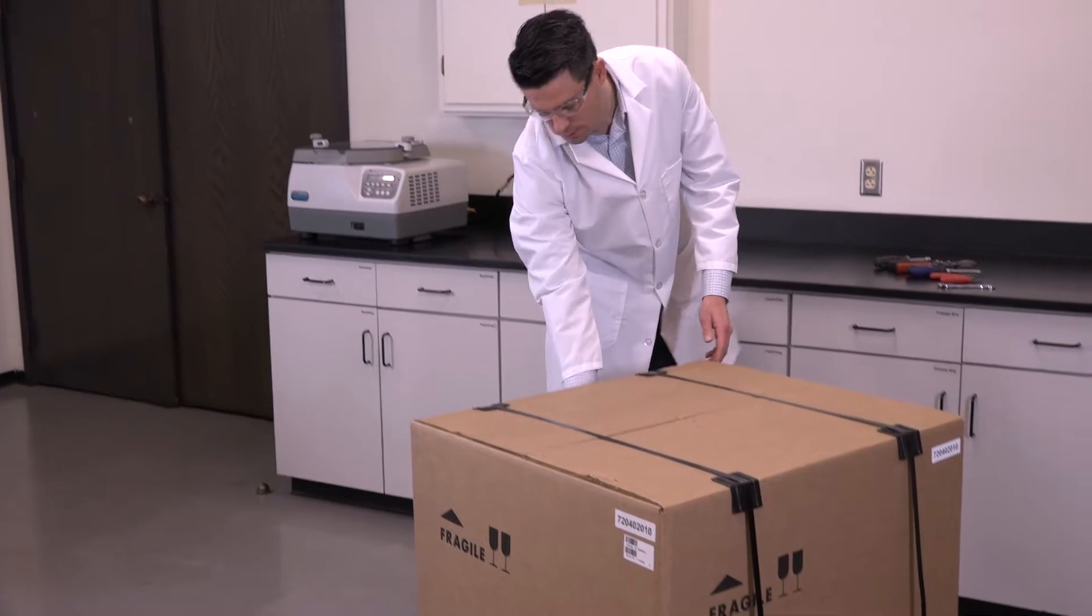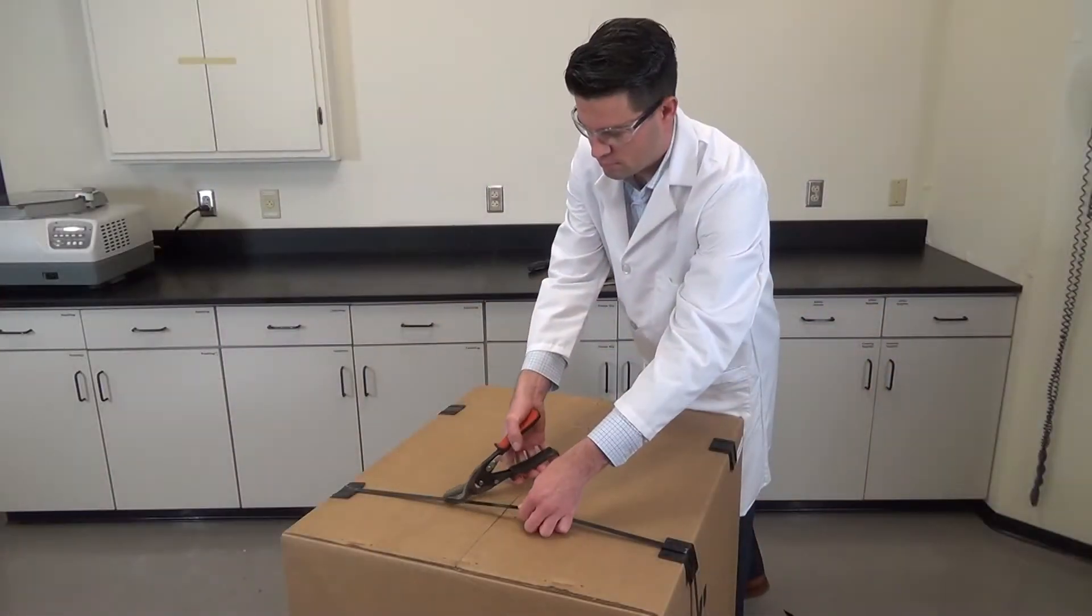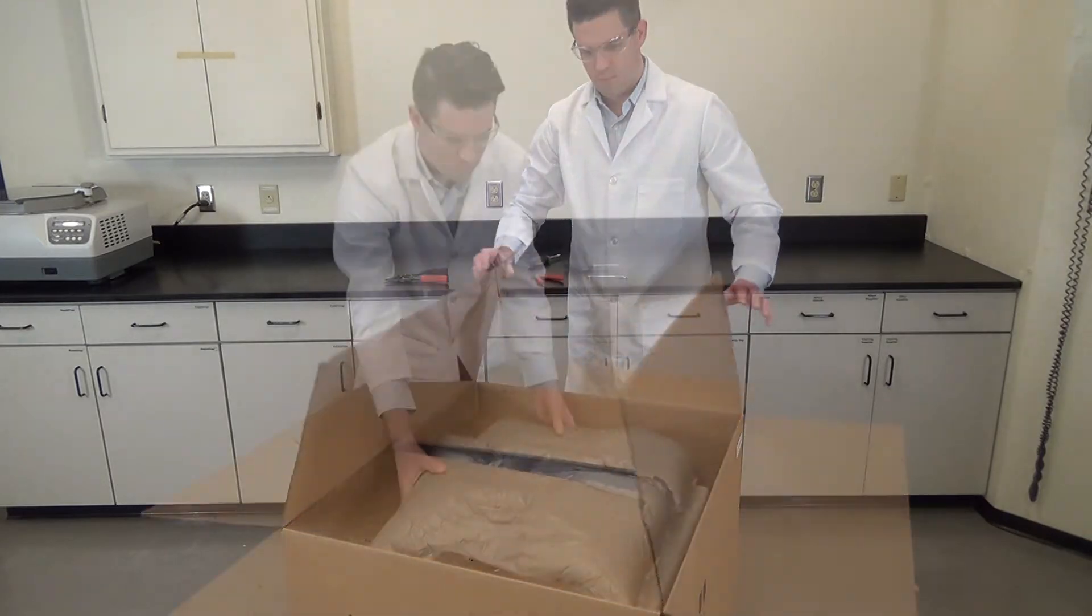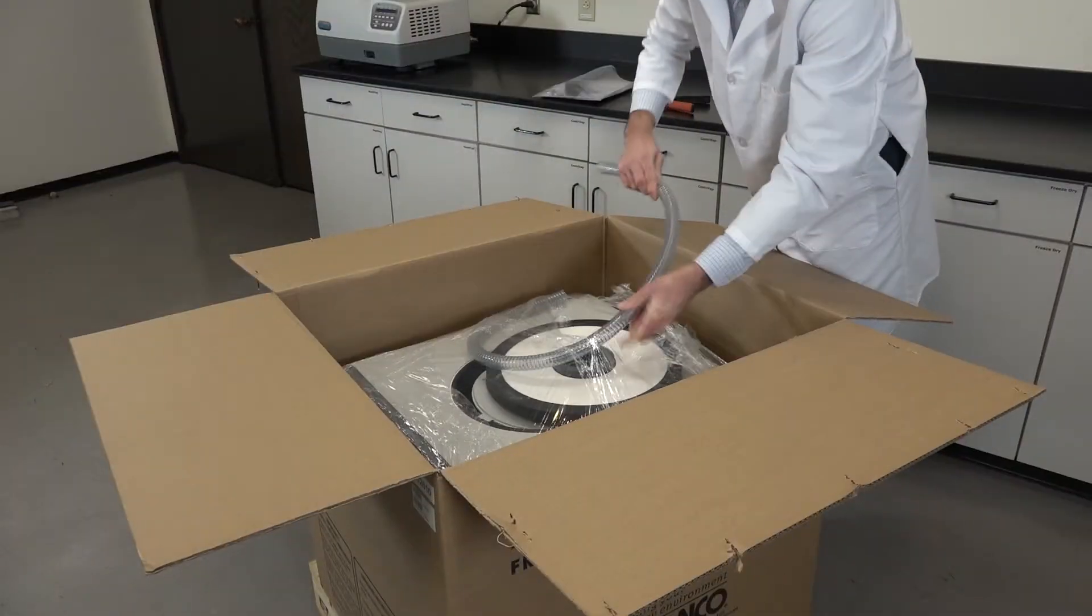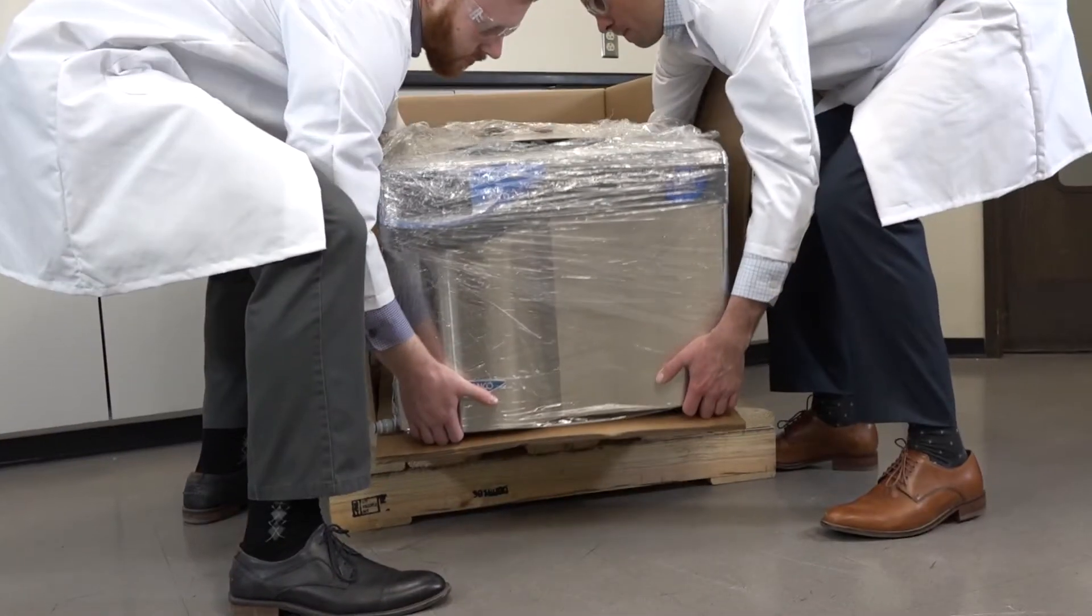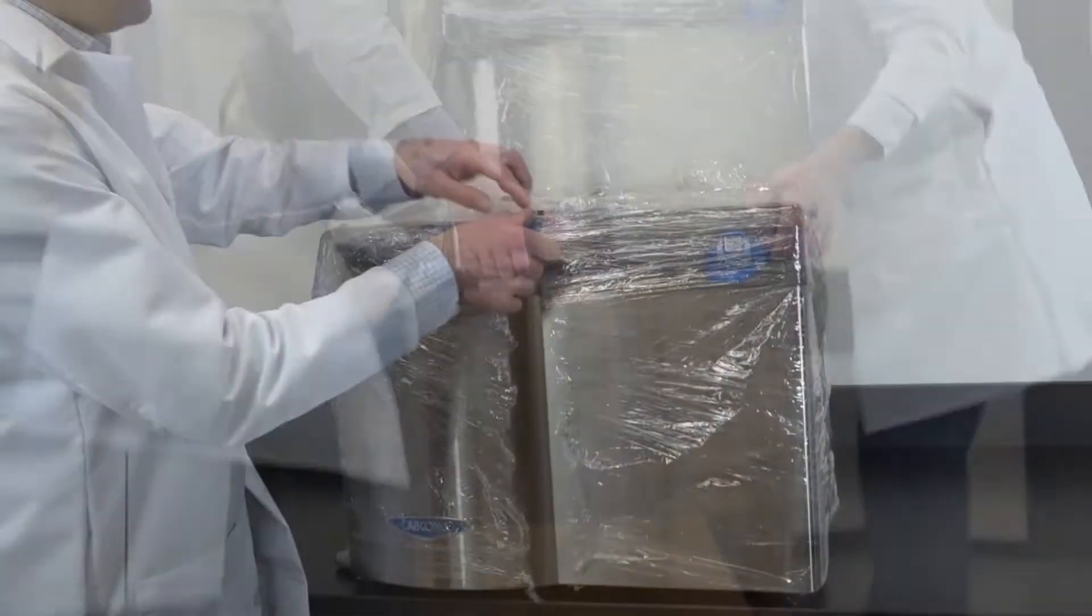Follow these steps to get your new Freezone ready for use. Upon delivery, thoroughly inspect the Freezone packaging to ensure damage did not occur in shipping. Don't discard the carton and packaging material until you've successfully installed and tested your freeze dryer.